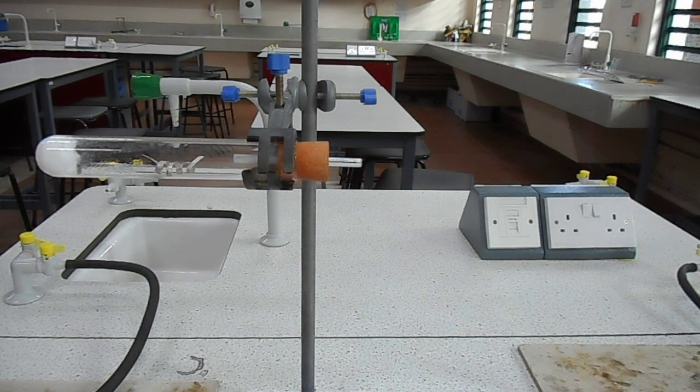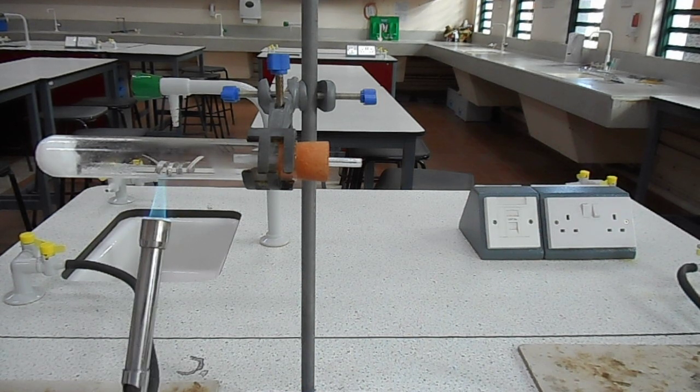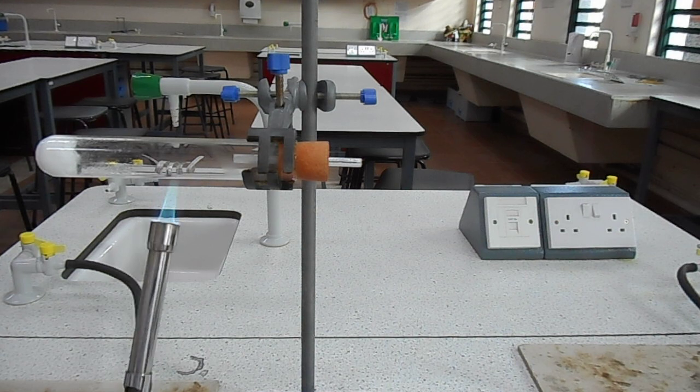We can encourage the magnesium to react by heating up the water until we get steam. So here's the reaction of magnesium with steam.